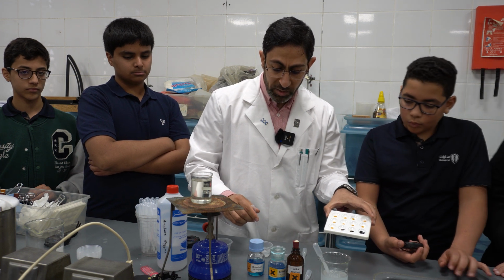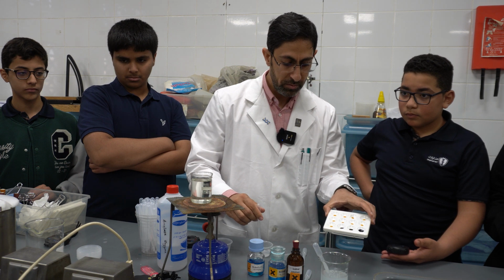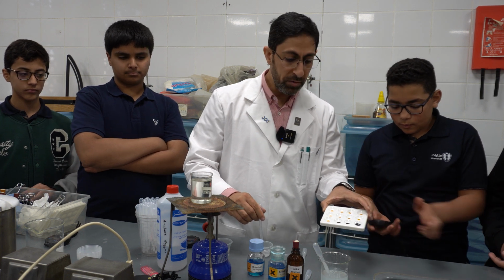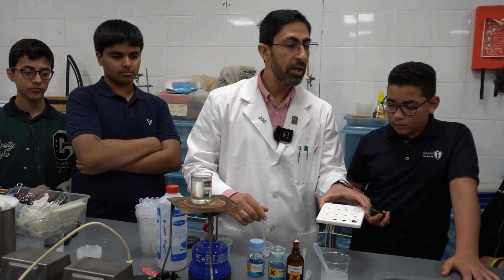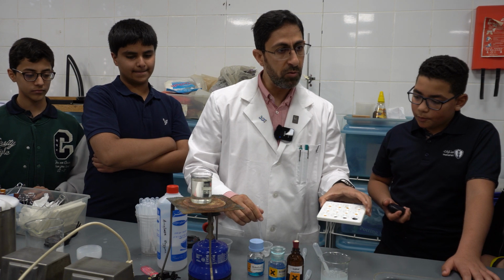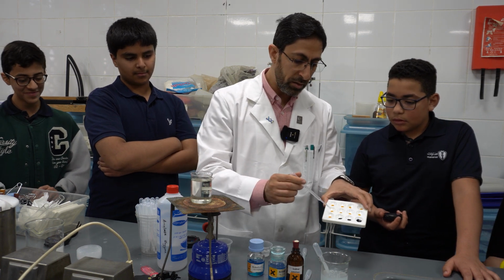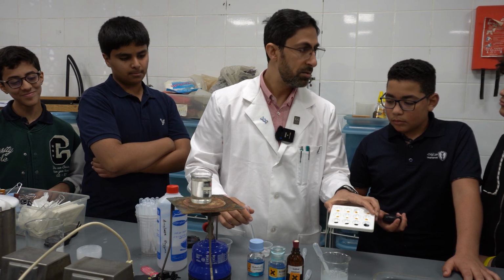Now the enzyme amylase works on the starch and breaks it down. So now the enzyme is present, but the limiting factor is the time. The more time taken, the more starch is broken down, because there is more chance for the enzyme particles to collide with the starch. I'll add another drop. Still blue-black, but a lighter color.